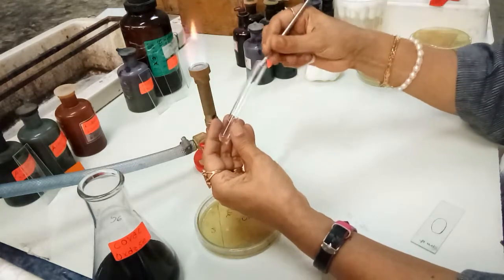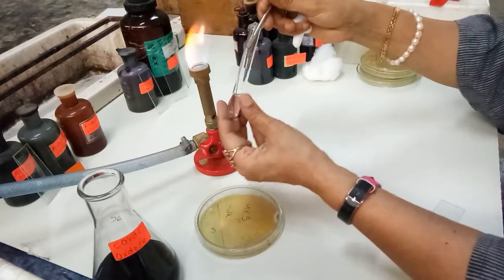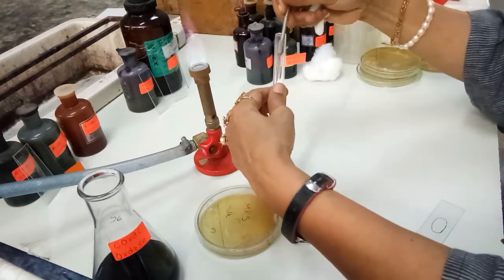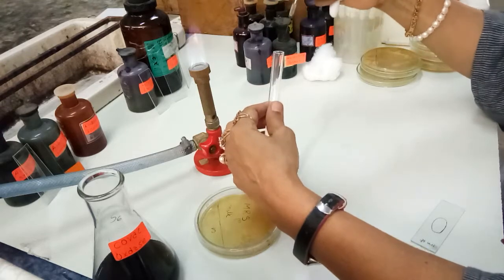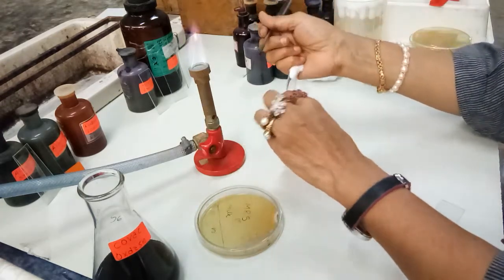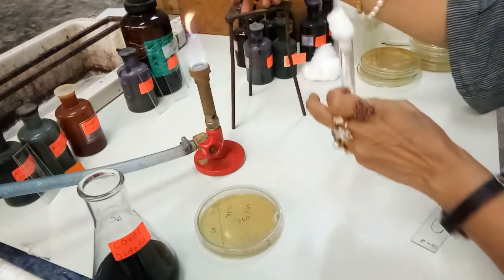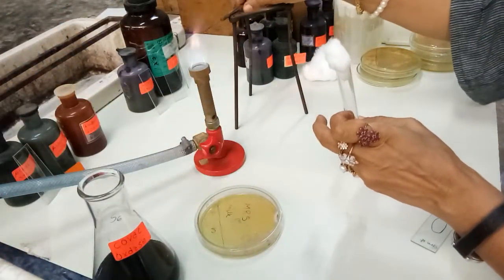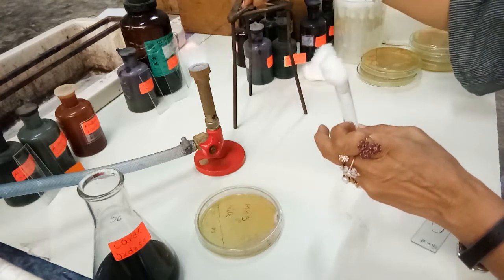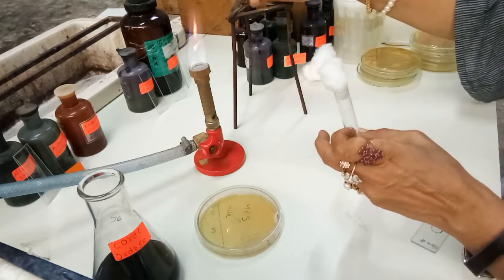I have taken the material of the colony and added it to distilled water. I am trying to make a homogenous suspension of this bacteria. Sterilizing the mouth of the tube again, and putting the Nichrome wire back for sterilization.